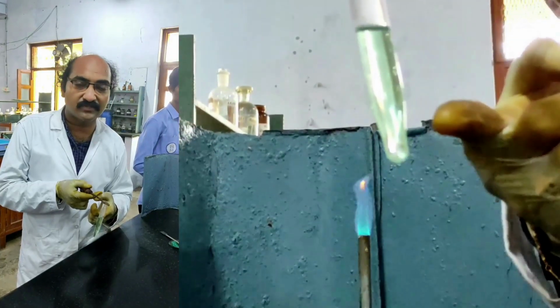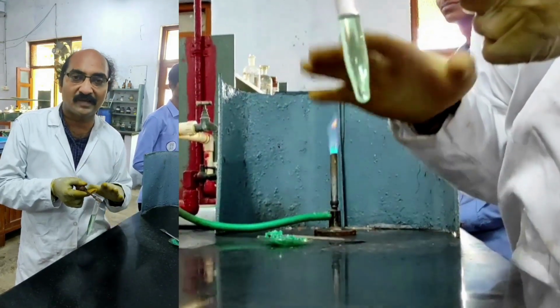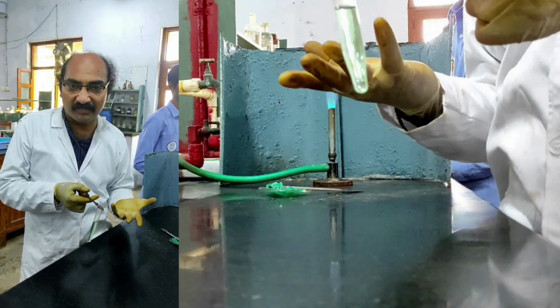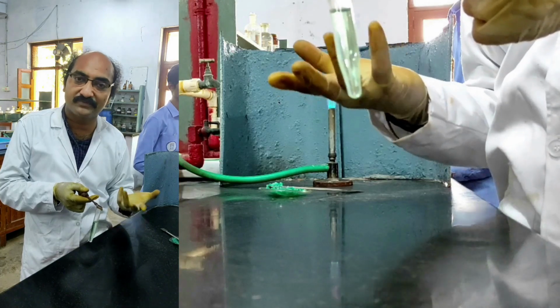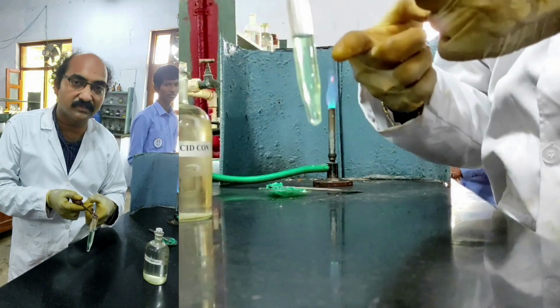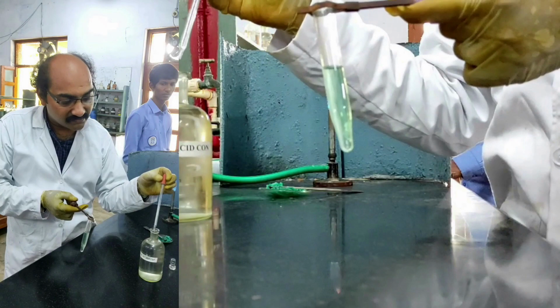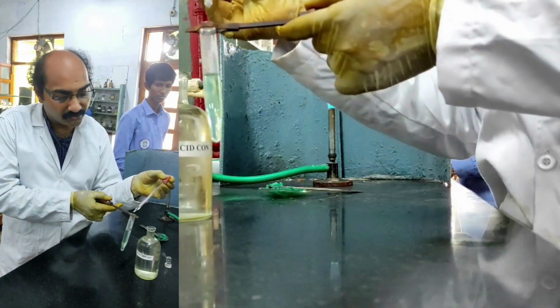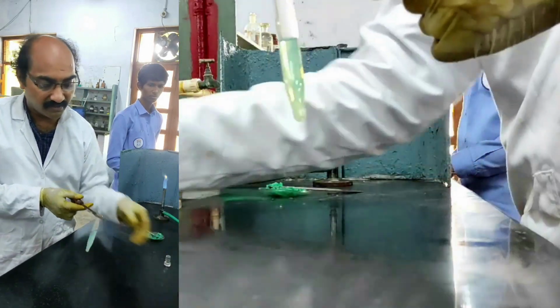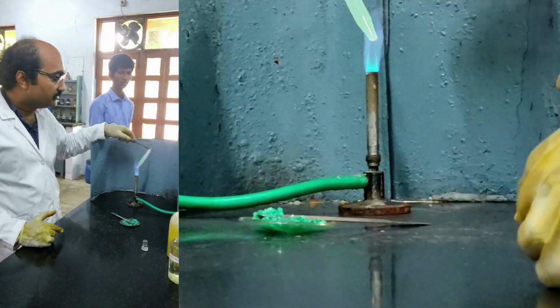The original salt mixture solution is initially mixed with dilute HCl. I did not get a precipitate. It indicates the absence of first group cations, and then I passed H2S gas through this. I did not get any precipitate, which indicates the absence of second group cations. Now I need to expel the H2S gas present in this solution. For that, I am adding 1 or 2 drops of concentrated nitric acid and then I am heating this to expel the H2S gas.